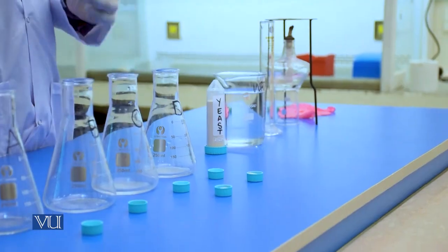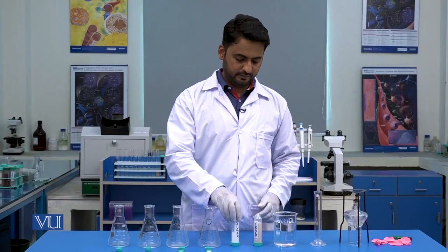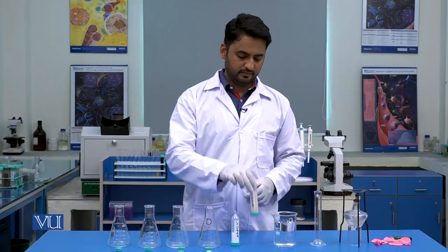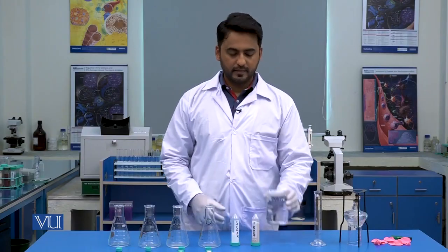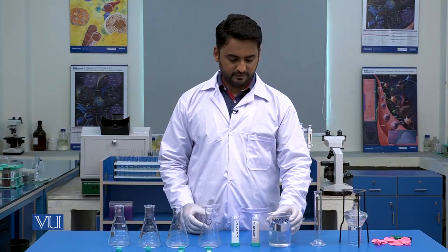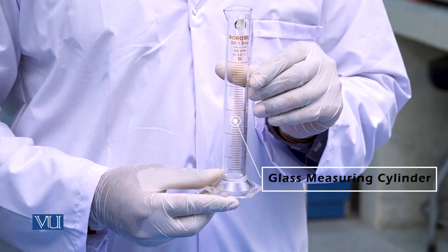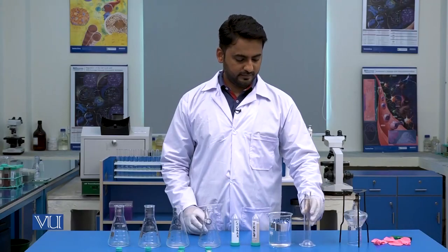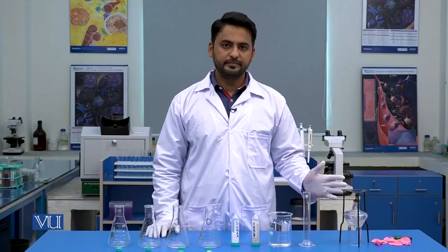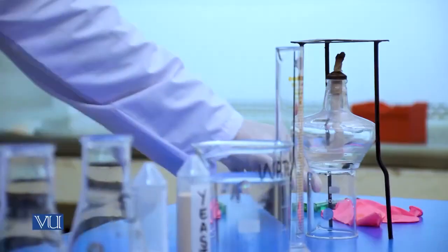Then we will use sugar, yeast, distilled water, a glass measuring cylinder, a tripod stand along with a spirit lamp, balloons and a lighter.